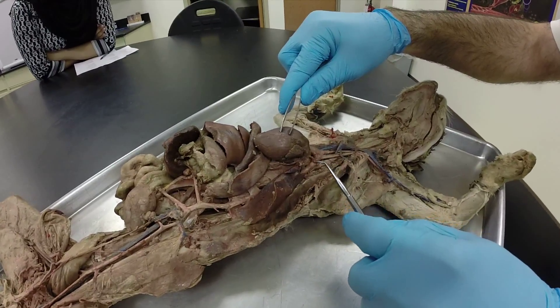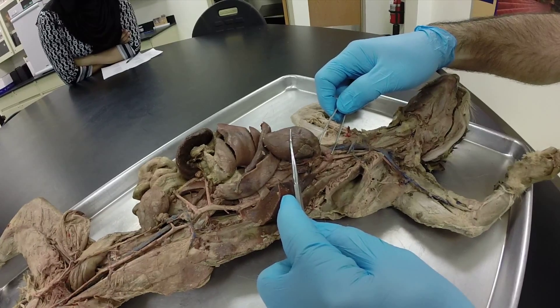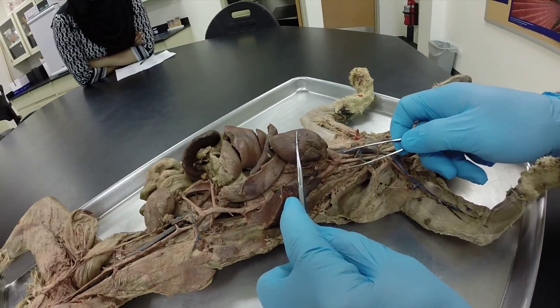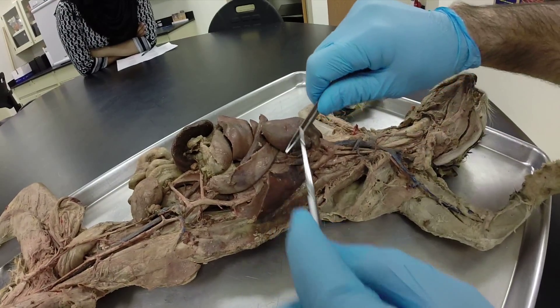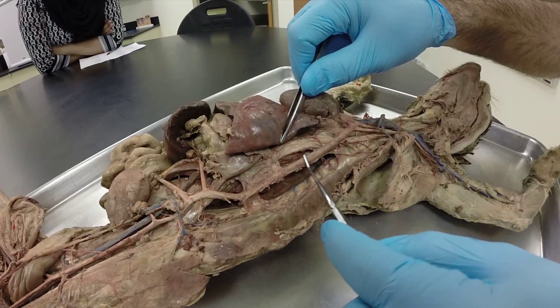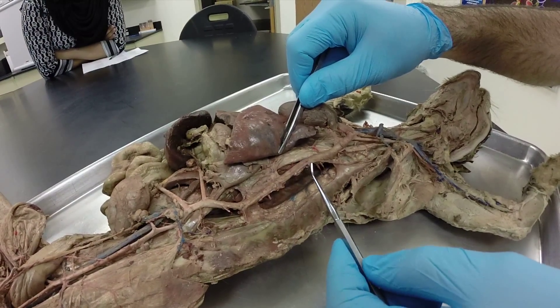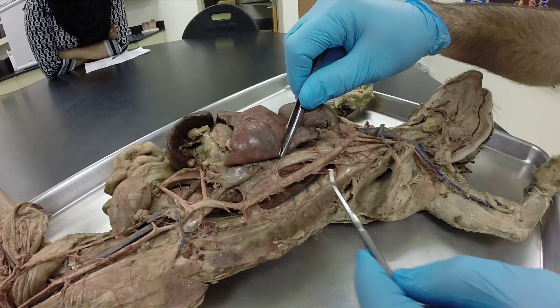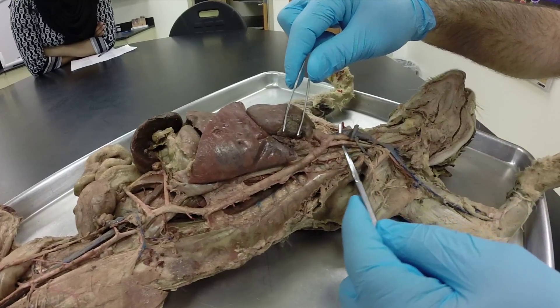This is the aorta. From here going uphill, this is the ascending aorta. From here where it's in an arch, this is called the aortic arch. Where the aorta turns down, we call this the descending aorta, and when it's located in the thoracic cavity we call it the descending thoracic aorta.